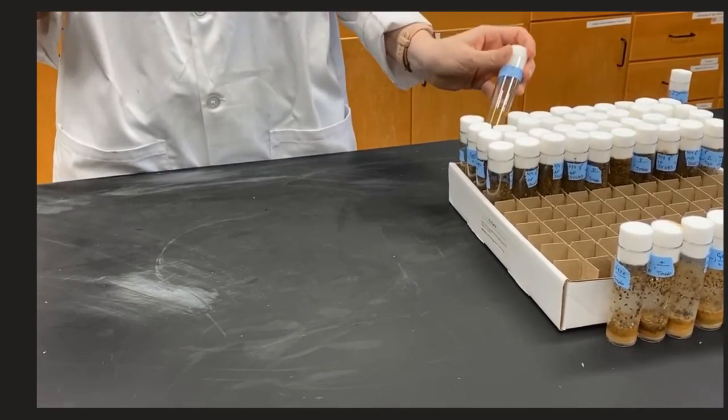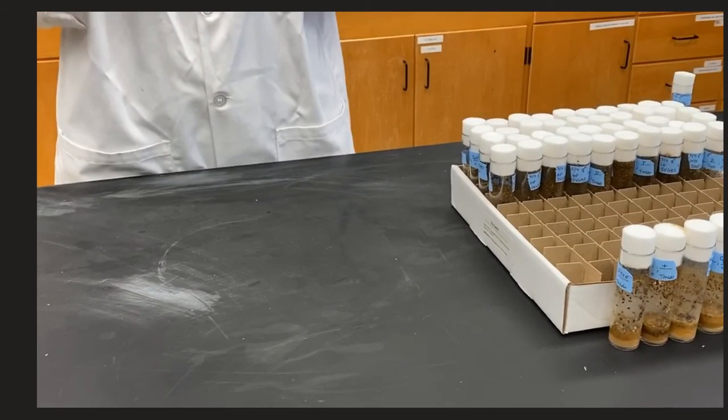Once complete, you can see the newest vial that we just flipped at the front and the previous oldest vial at the back to be frozen and discarded.